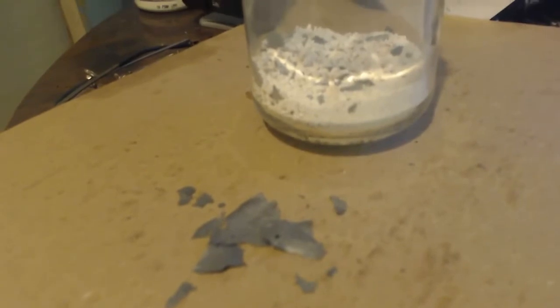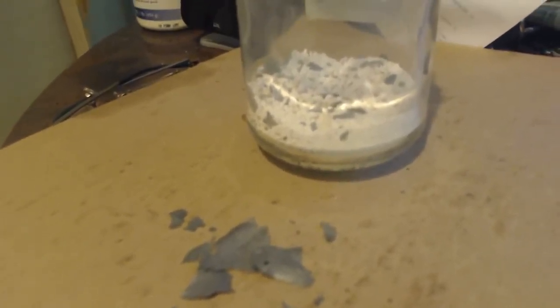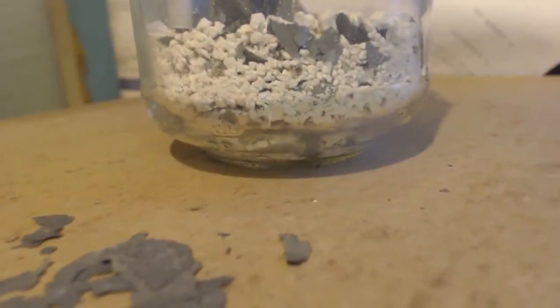So there it is. I took it out after an hour. Probably took 10 minutes for it to get up to temp. You can see I put a couple flakes here so you can see it. It's real thin, but you can see it's inside the thing. That can that I had it in, oh my god, it just burned it to pieces. And little pieces flaked off and stuff, so, you know.